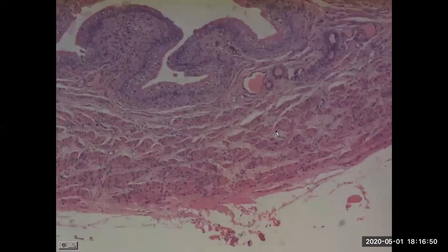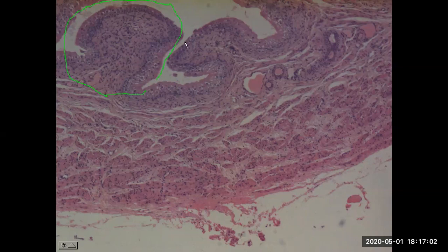So the next sample is now the urinary bladder. And within the urinary bladder, the first trait we'll point out is the big folds of tissue. So these are the rugae. So just the large folds of tissue. And now starting at the mucosa, the superficial layer, that's the name of their layer, is the mucosa. But taking a look at the actual tissue, the cells, we have transitional epithelium that's in the layer called the tunica mucosa, or just simply mucosa.